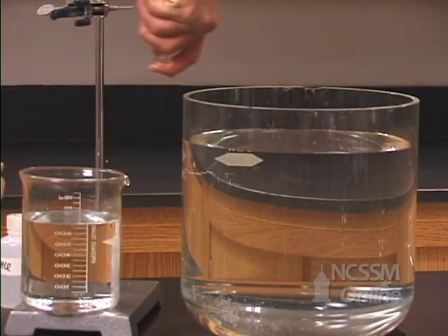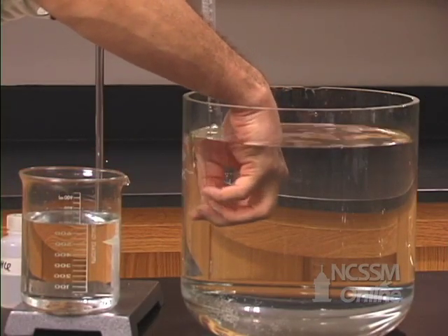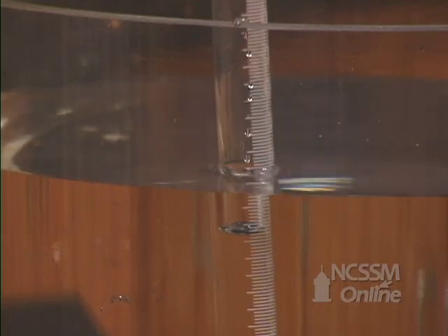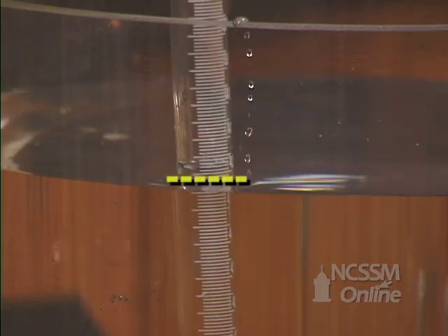We will now transfer the tube to a large water tank. We will raise or lower the tube so the water level inside the tube and the water level outside the tube are the same.